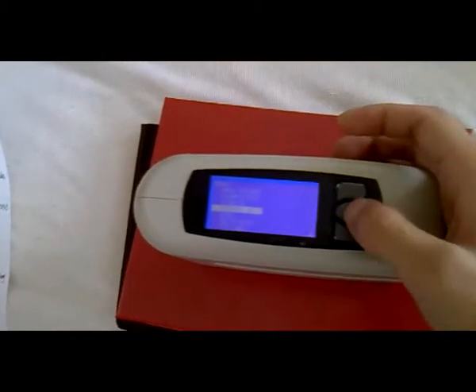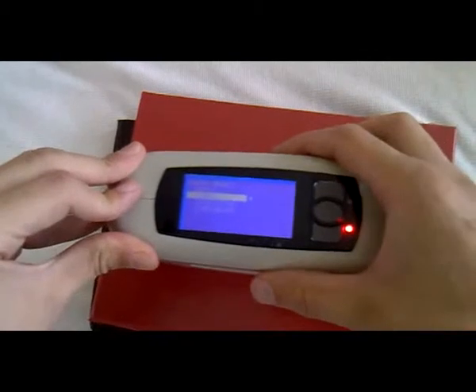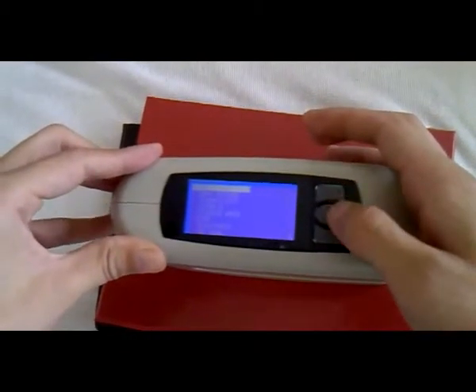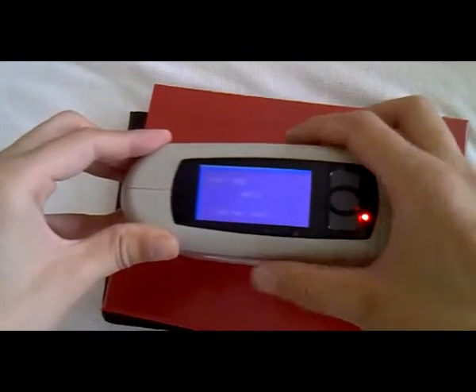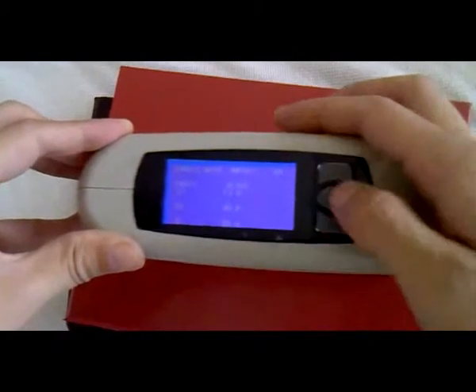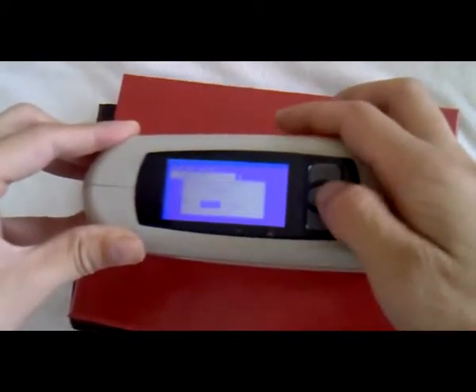Press up and down to choose what you want. For example, we choose the mode. Choose the simple mode and press the menu key. Then press the test key — it will tell you save or not. We choose yes. All we test is the simple mode. And save the simple mode — 001. To the basic mode, test, save, yes.